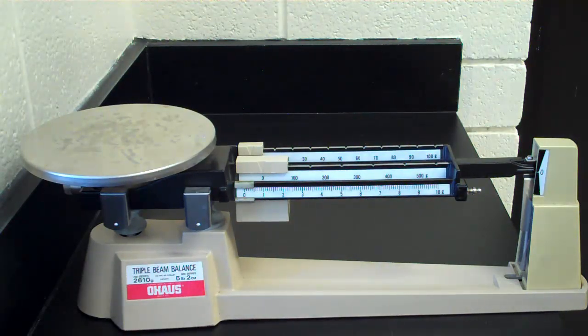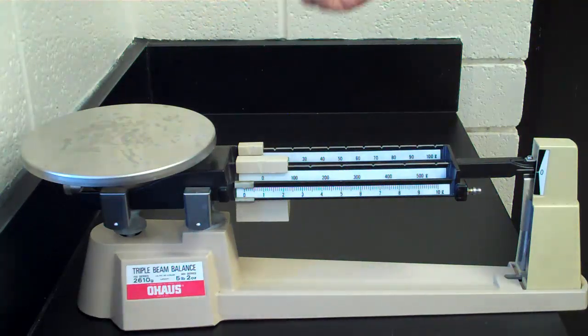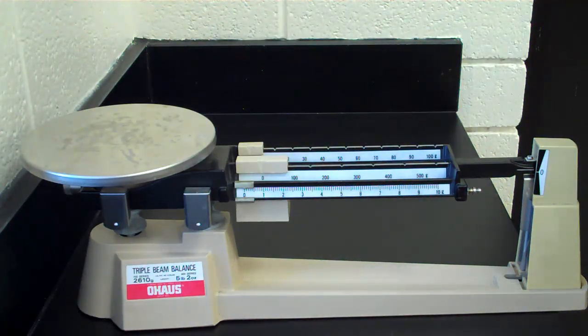Alright, we're going to do a demonstration on how to use a triple beam balance. I know some of you may have done this before, for others this is a new skill or a new tool.